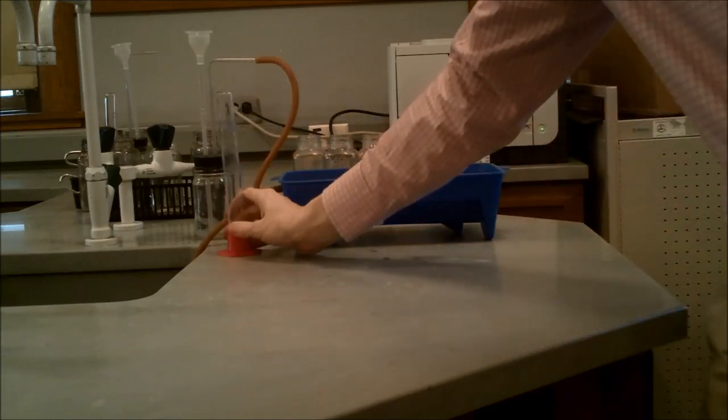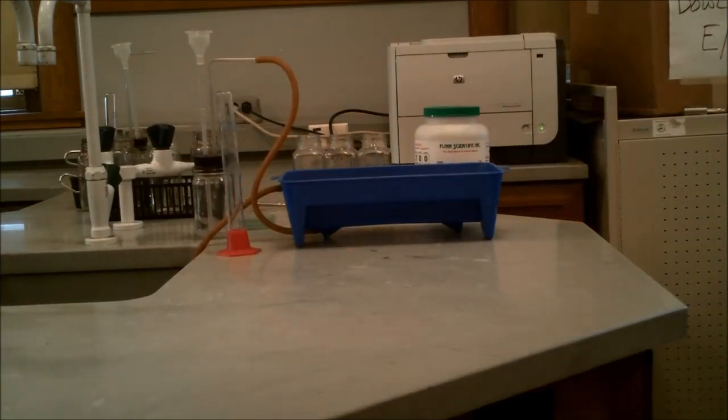This is the graduated cylinder. Okay, the next thing is part one of the procedure, assembling the gas collection apparatus.